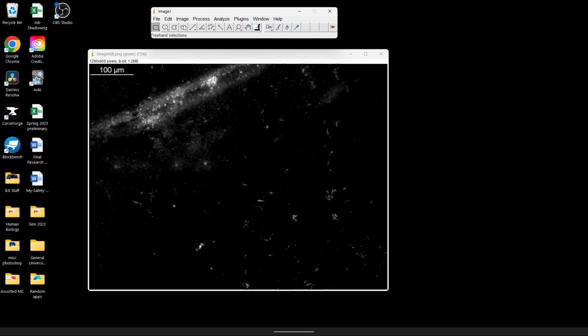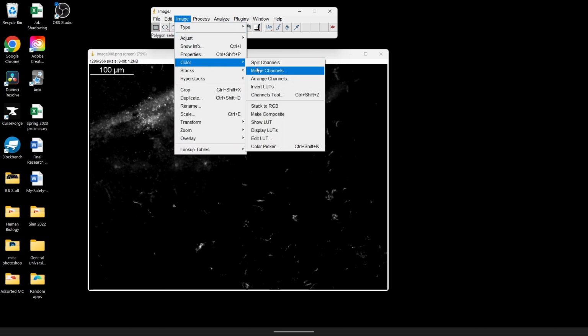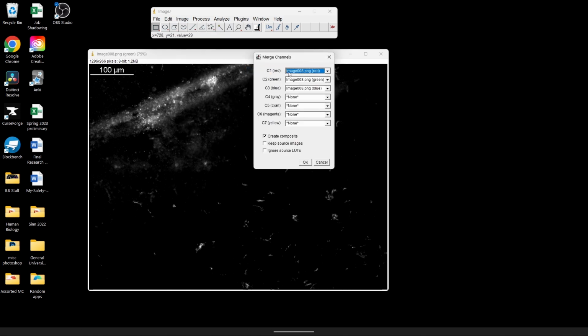So we're going to go to Image, Color, Merge Channels. Now we have to make sure that all of the channels are in the right spot. So these ones are really nicely labeled for ImageJ by us, so it has the parentheses in red so that you know it goes to red. But that's not always the case. And so sometimes it's going to call it C1, C2, C3, but it might not remember exactly what color it is. And so we have to make sure that we look at every single one in those cases to make sure that the red is actually the red and the green is actually the green.